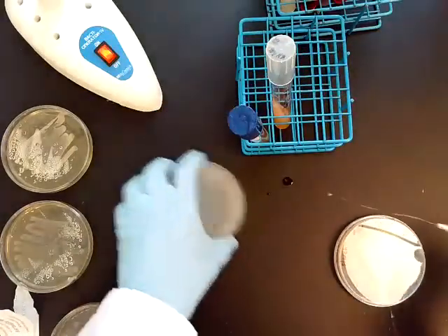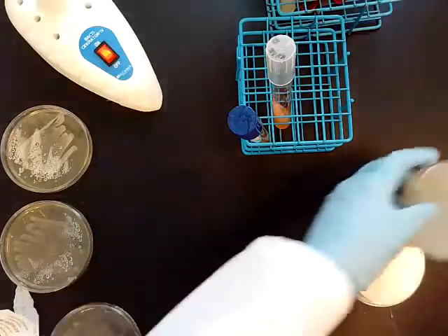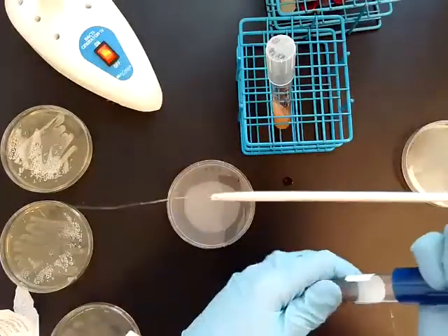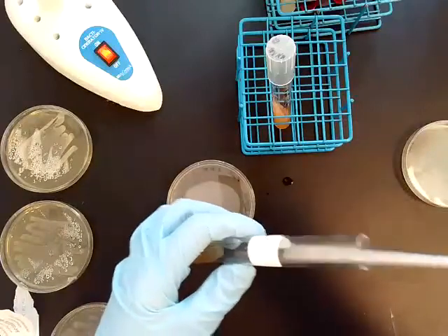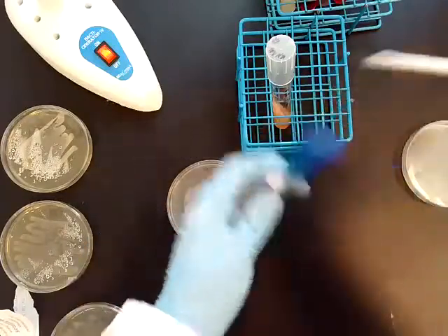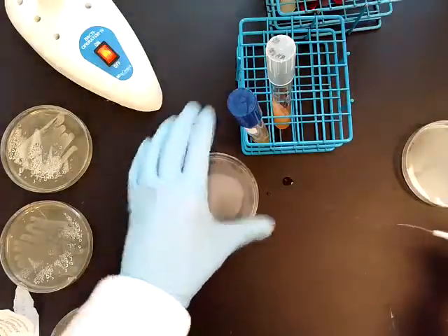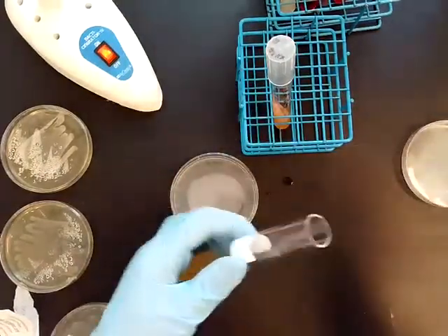Because I'm using the same species and I know it's a pure culture, I'm just going to keep inoculating the next plate. Again, I'm going to streak another two lines down the center of the plate.